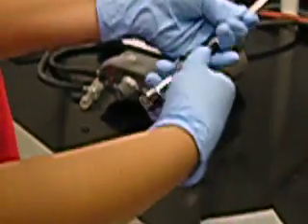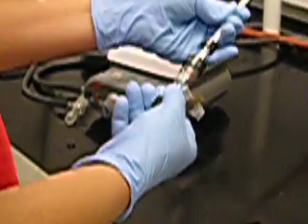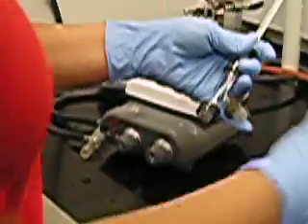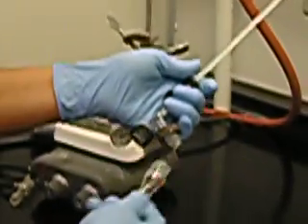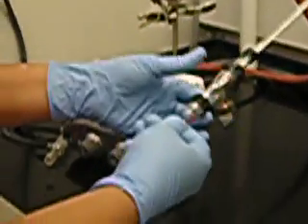You'll notice so far that our assembly looks a lot like a simple distillation assembly. But right now, we actually find our fractionating column, which is our thing that's different, and attach it to the bottom of the distillation head as well.